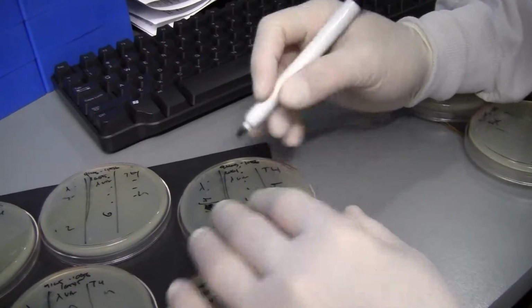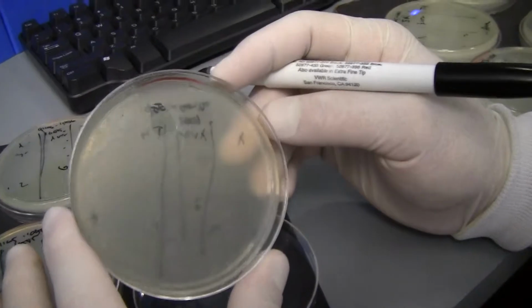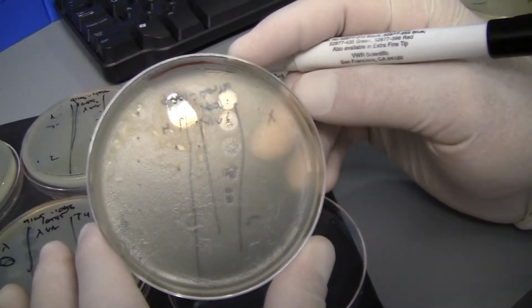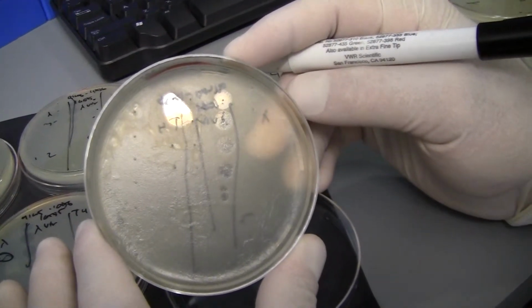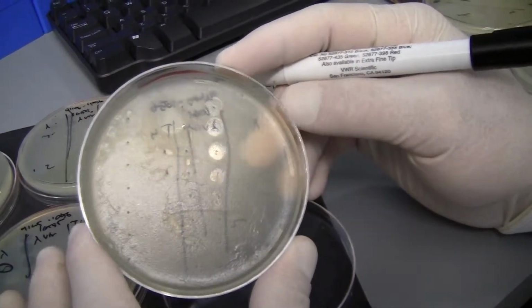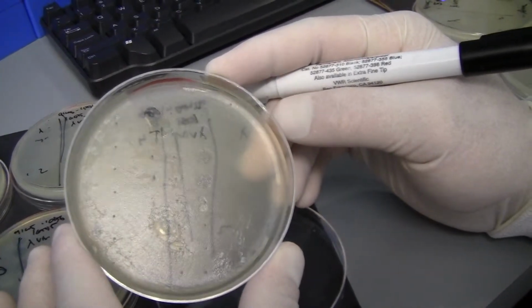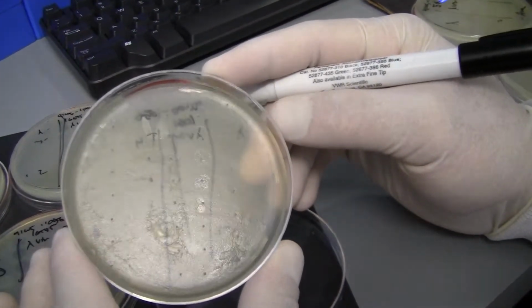1, 2, 3, 4. And then here, this is an ugly plate. Yesterday, this was the one that we messed up, and you can see there's that gigantic clearing there. That's not phage. That's just where the top agar refused to go over. And you can see the rest of the plate is just kind of ugly looking. So when you have these gross looking plates, it just makes the experiment a lot harder to read, which is too bad.